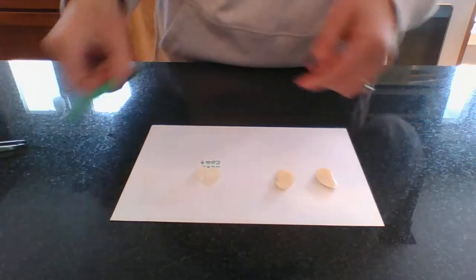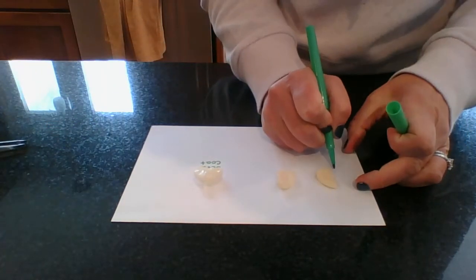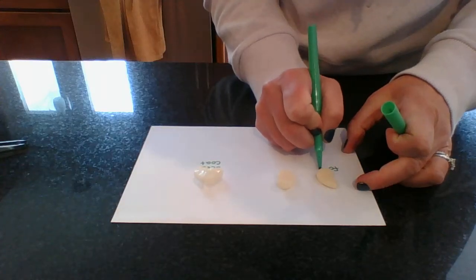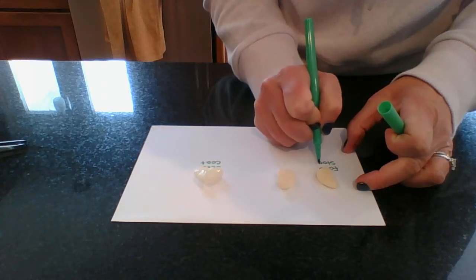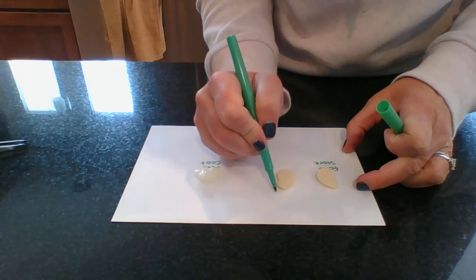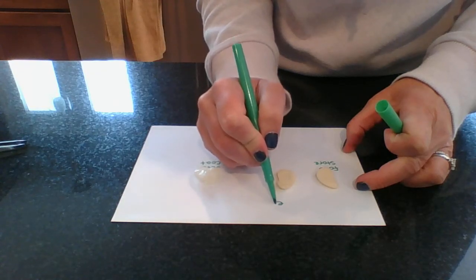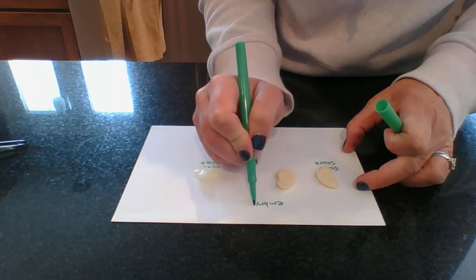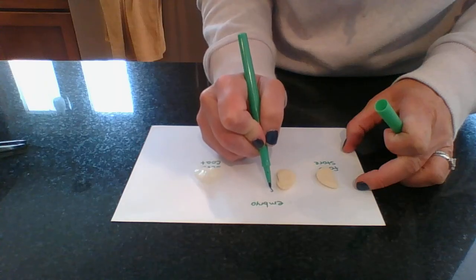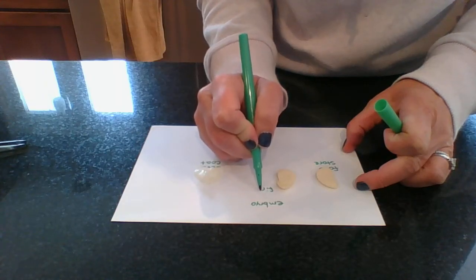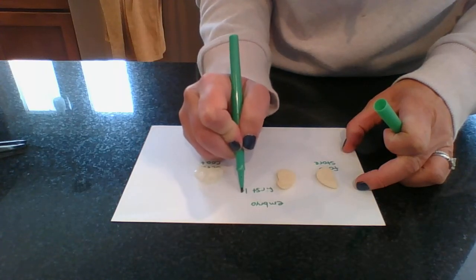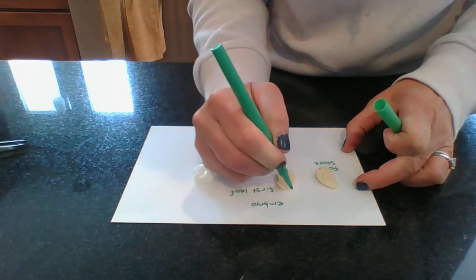So we have the food store and we have the embryo. And the embryo has two different parts. It has the first leaf and it has the roots.